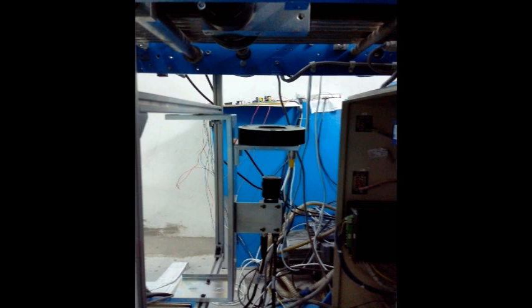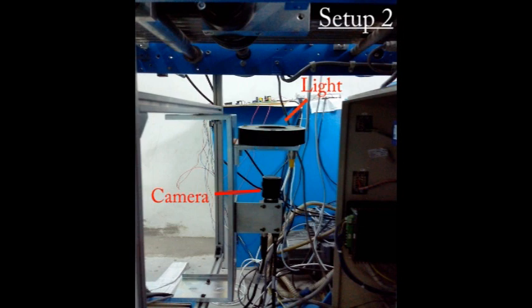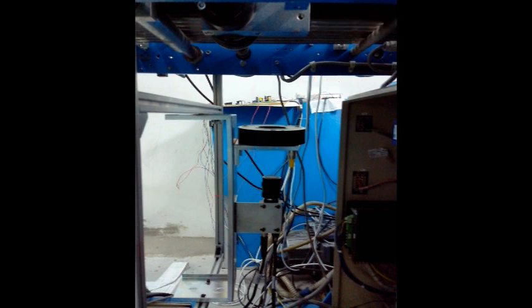The second setup includes another ring light and a camera. The timing and field of view are analyzed and set up for each of the cameras precisely.